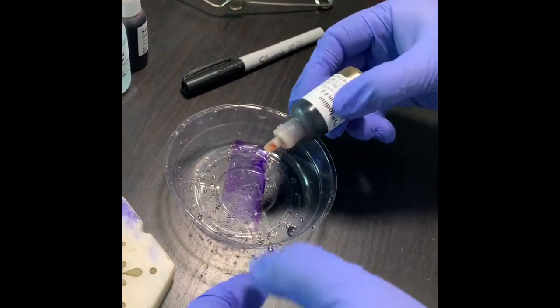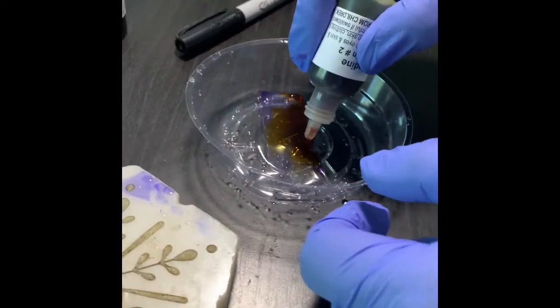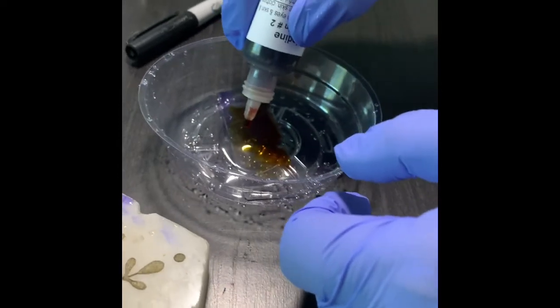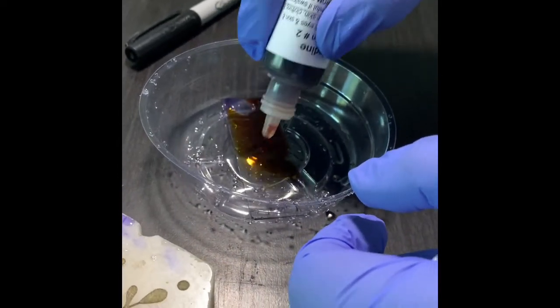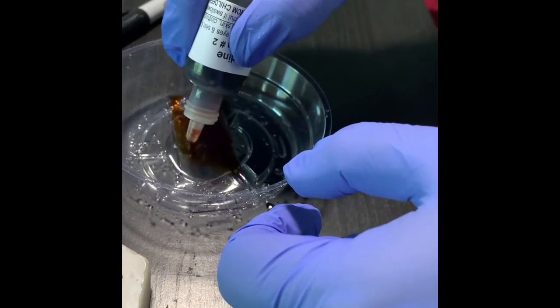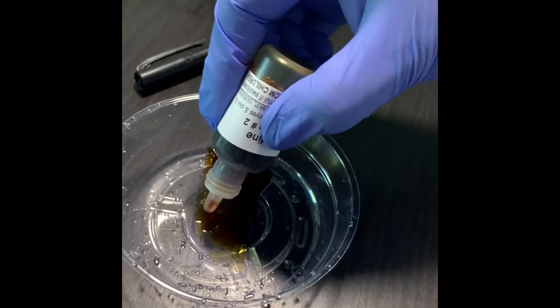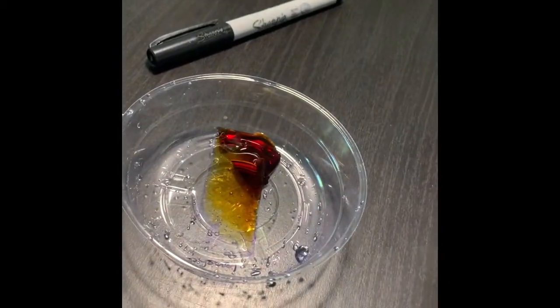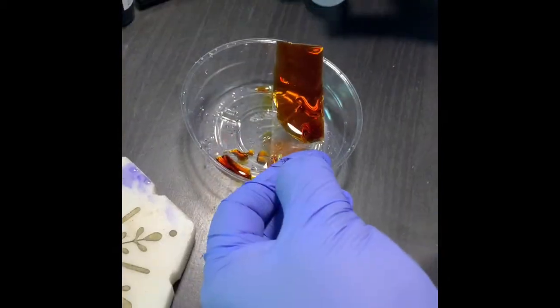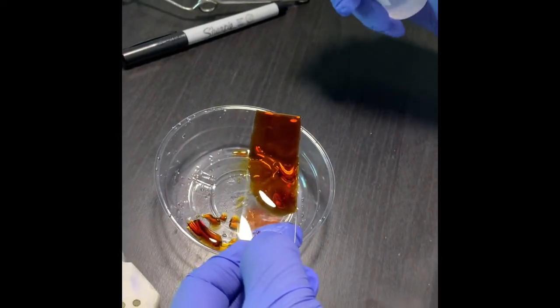That will also cover the whole staining area, and it will also be for a minute. Then I'll come back. Okay, so 1 minute has passed and now I will wash with alcohol.